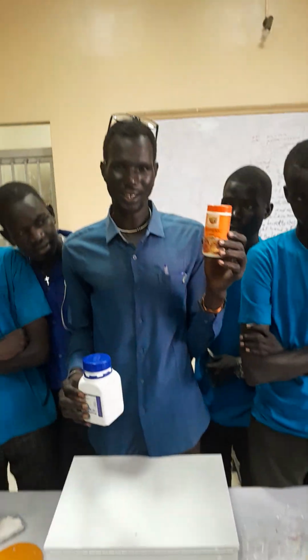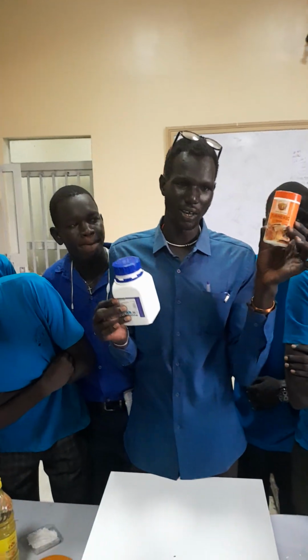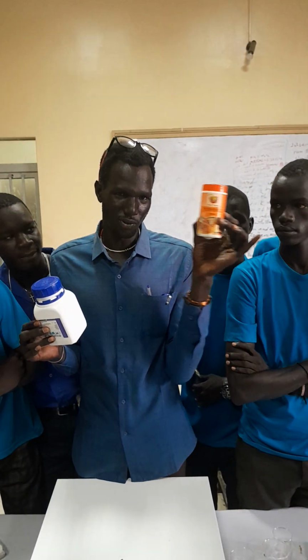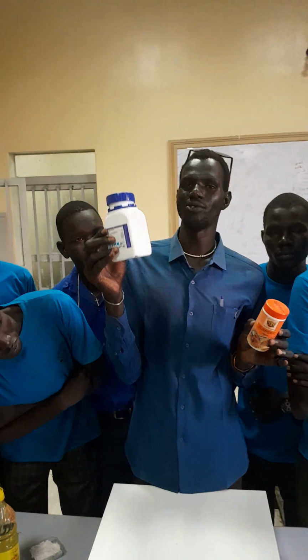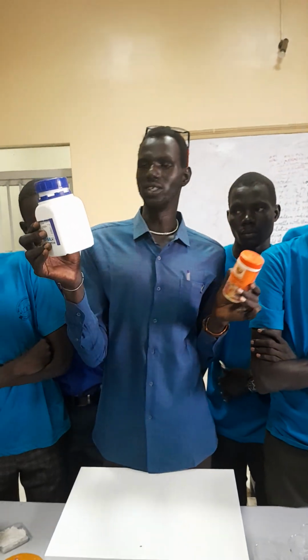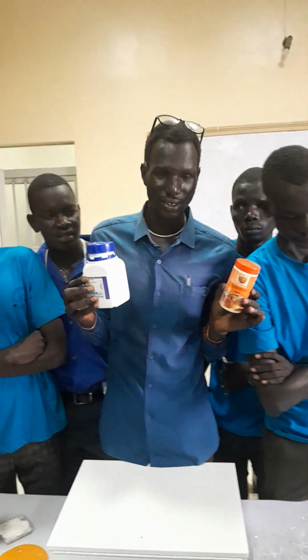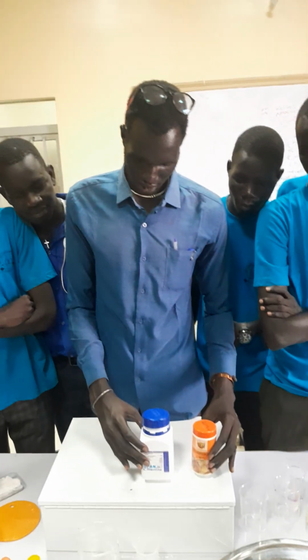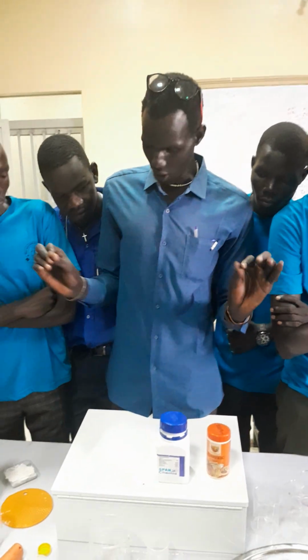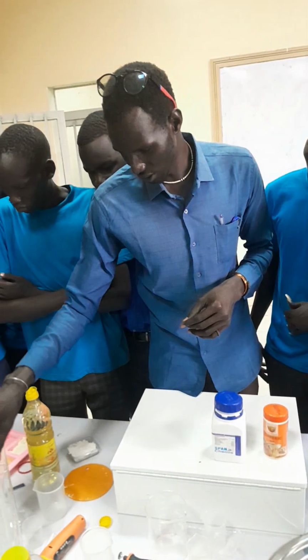So this is turmeric, and this is sodium hydroxide in the form of pellets. These are in the form of powder, and these are in the form of pellets. So this is turmeric for coloring, and this is sodium hydroxide. This is the base. Sodium hydroxide is the base. Okay. Now, before you do this, first you need to take a volume of liquid.